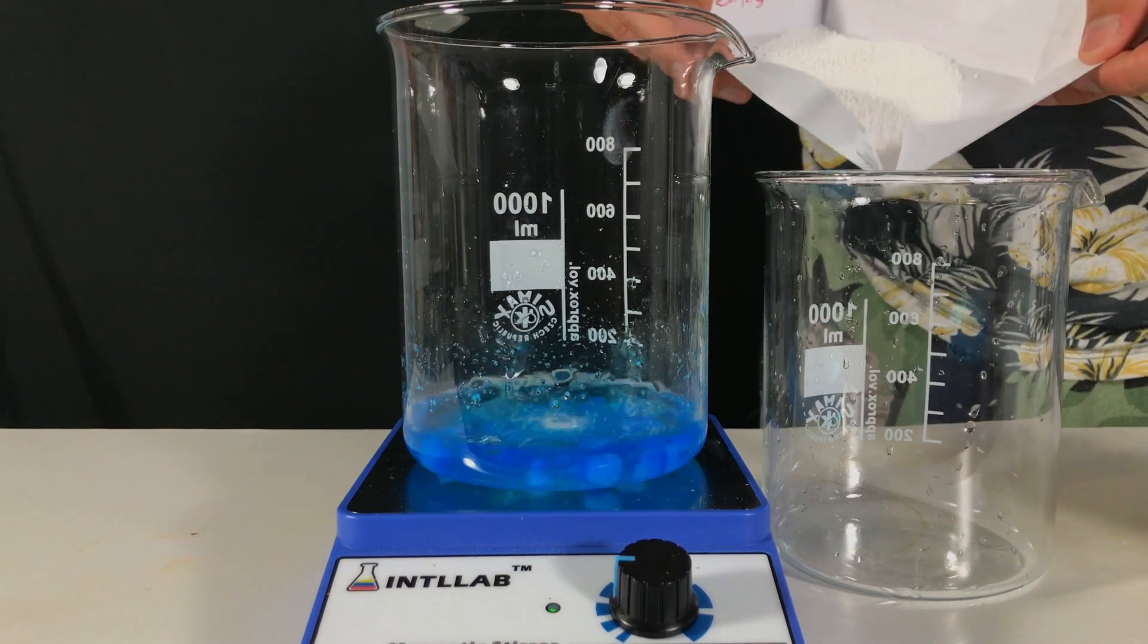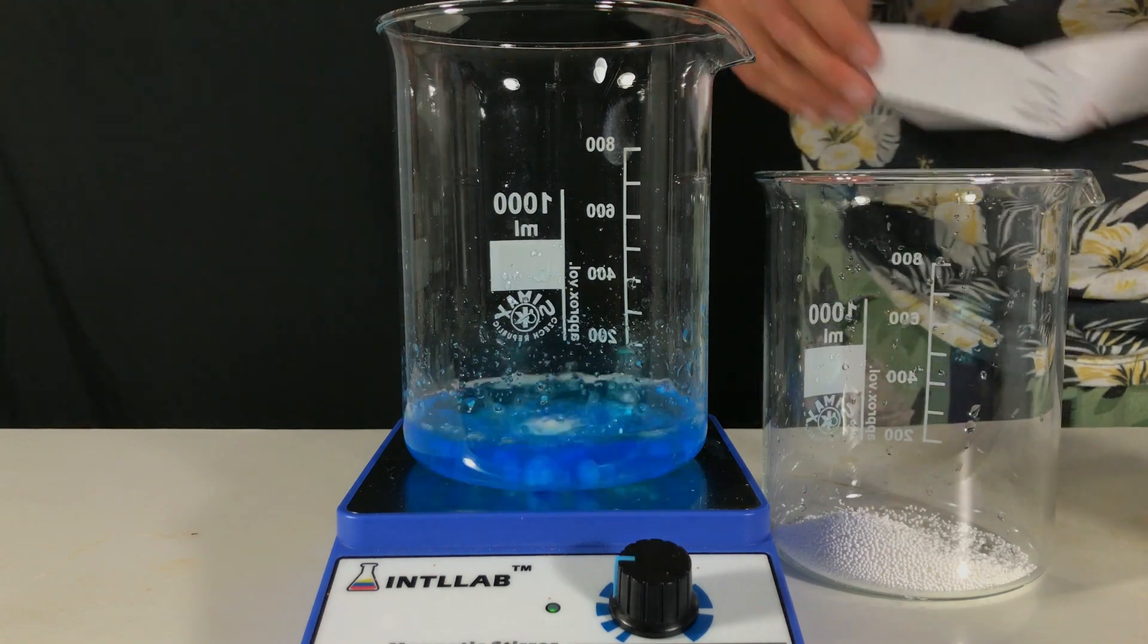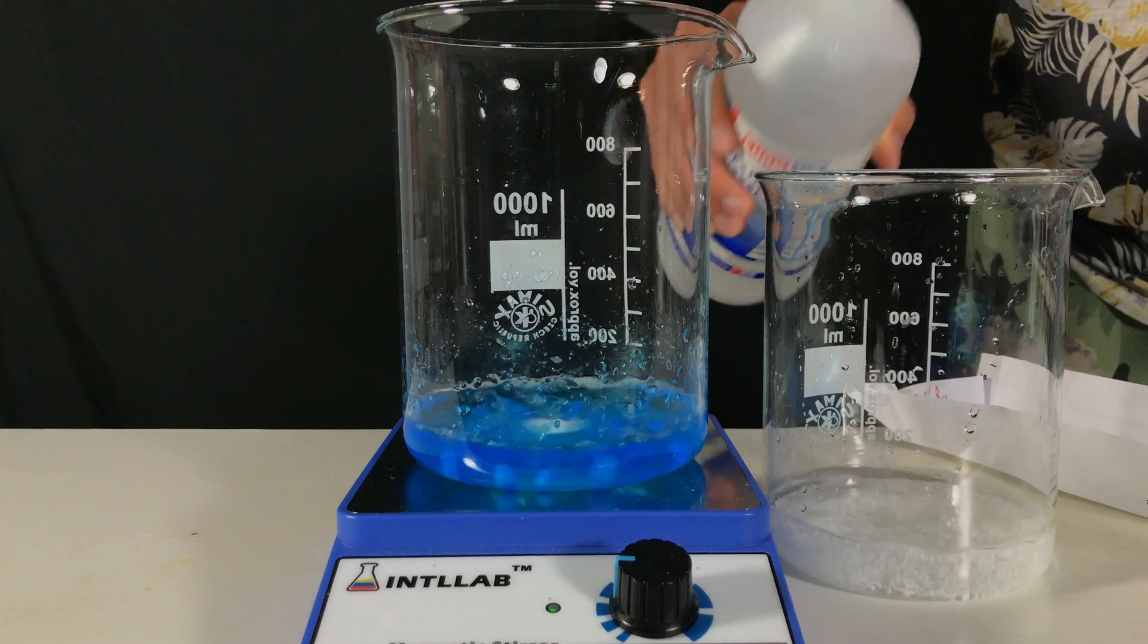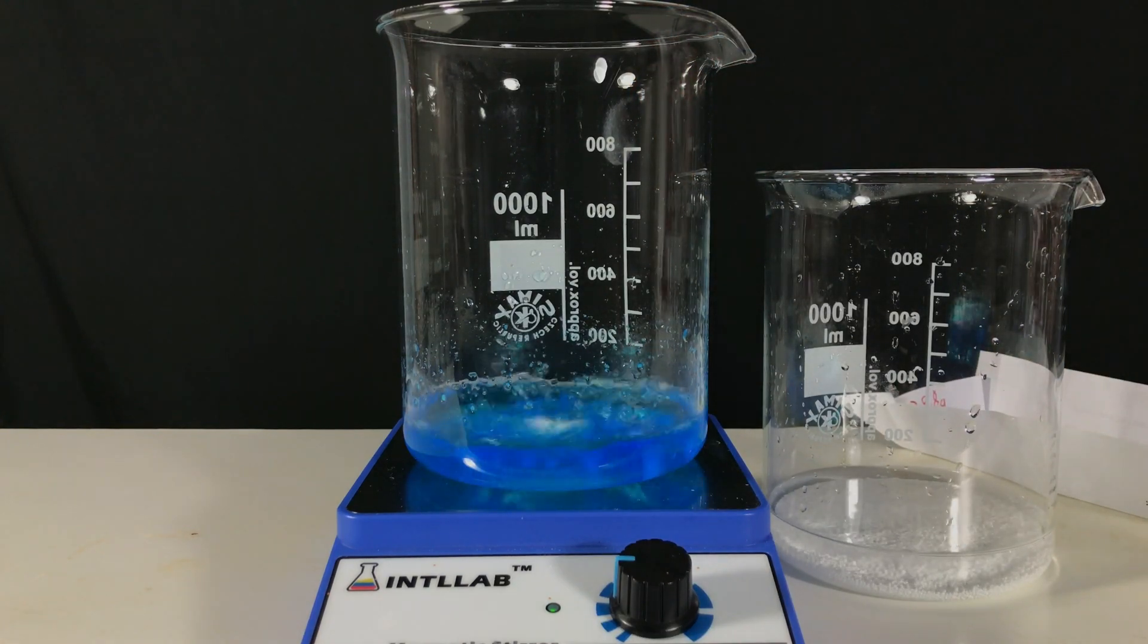To this beaker we transfer our sodium benzoate. Again enough distilled water to dissolve all of the sodium benzoate is added.